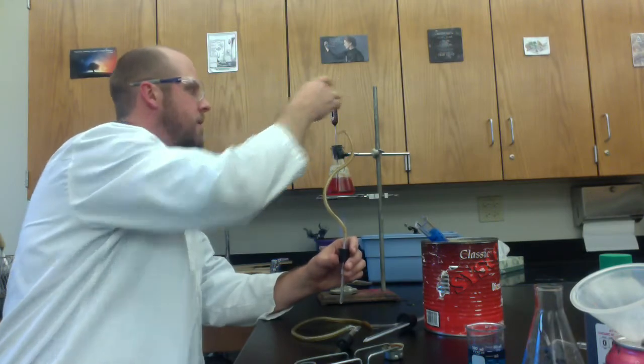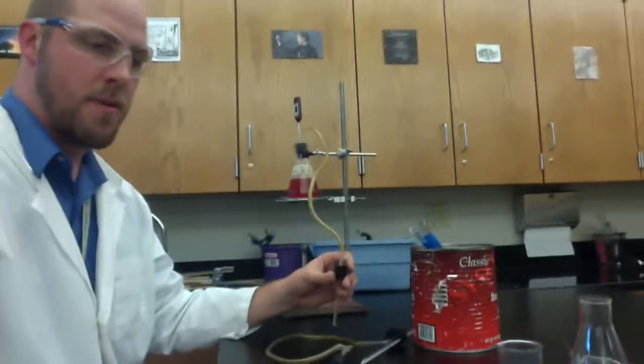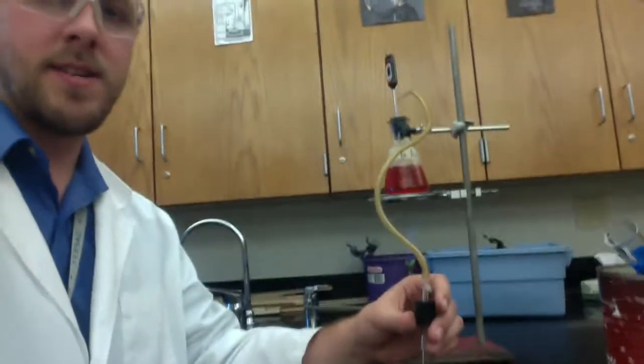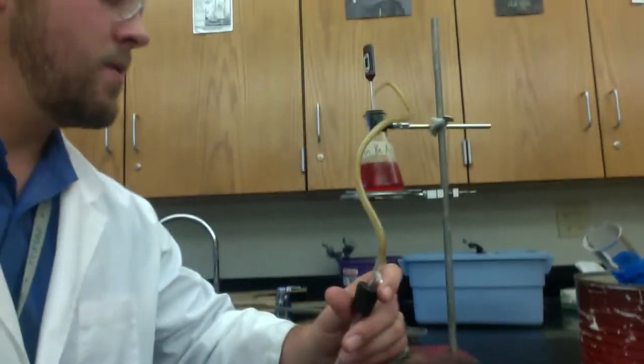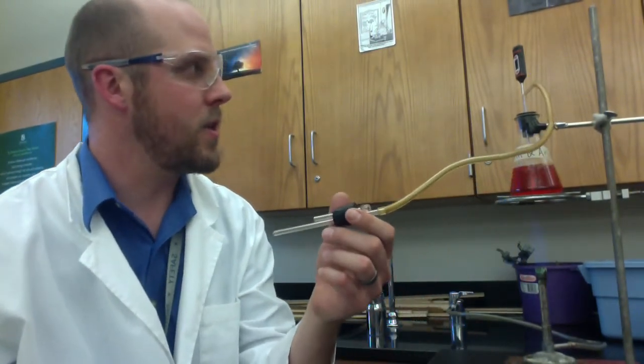And while this is happening, really good idea to have your thermometer on. One of the things you're going to be measuring throughout this lab is what temperature you notice different things happen at, what different things separate at. So right now I'm at 22 degrees Celsius, not warm at all.